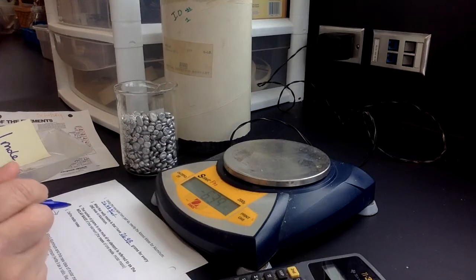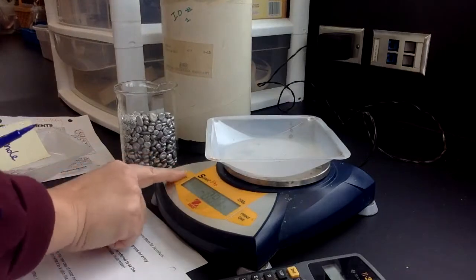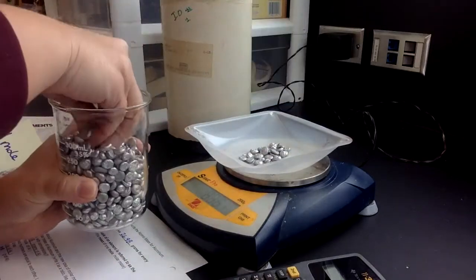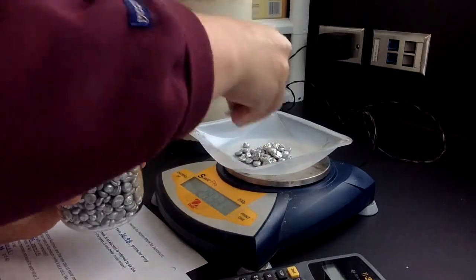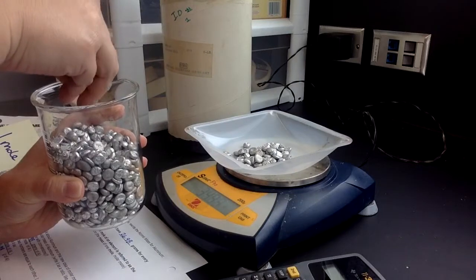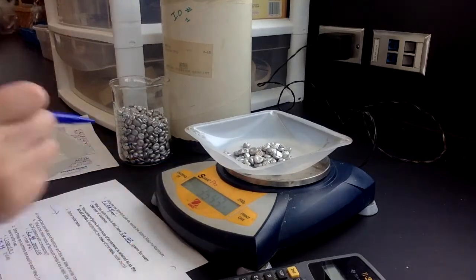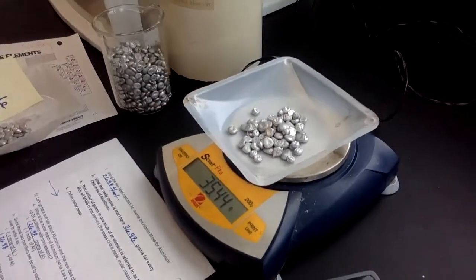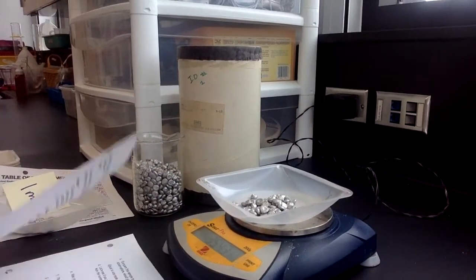Now I'm going to use the balance and measure out approximately 35 grams. So again, I take a weigh boat and I zero it out. That subtracts the mass of the weigh boat. And then it just asks for 35. So I'm going to put something close to 35. And again, it's safe for me to touch these little pieces of aluminum. So we're going for 35 as the goal. Oh man, I'm so close. I'm going to put one more piece in there. All right, and then it says record the exact mass. It says 35.42. Can you see that? So I did that, and we're at the bottom of that page.